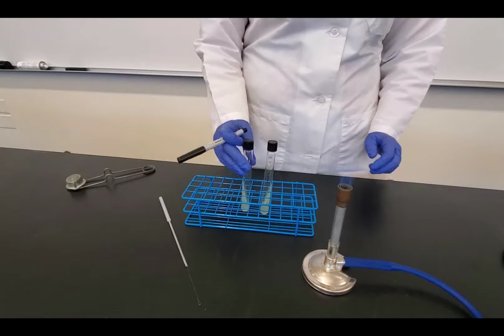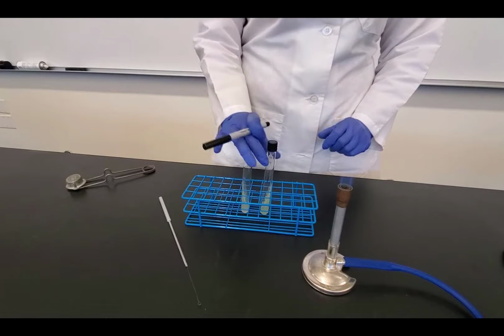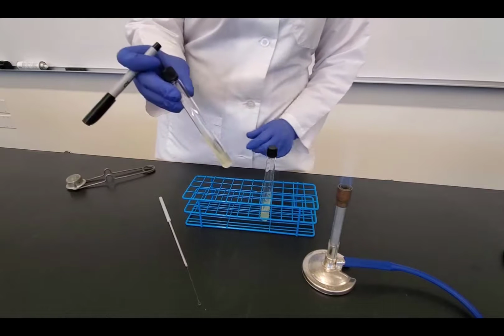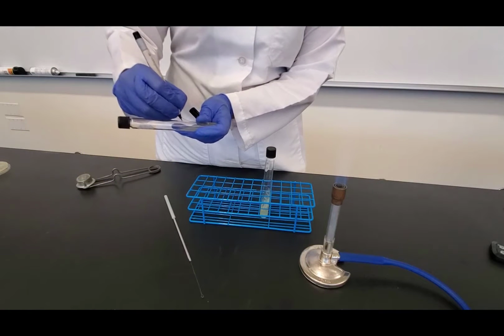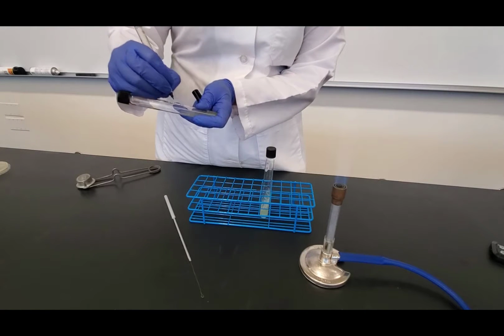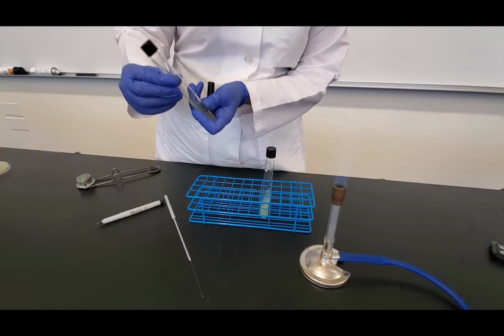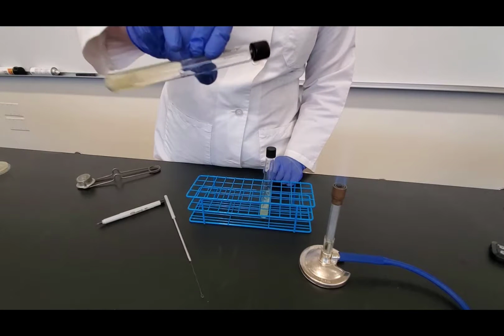So in this experiment, I would transfer bacteria onto the sterile slant. So this bacteria is on the slant growing, and I need to transfer from that tube onto the sterile tube. And so what I need to do is start by labeling the tube. And I label it with my initials, the initials of the bacteria, the date, and my lab section. Now it's labeled, and I labeled on the glass and not the white part.